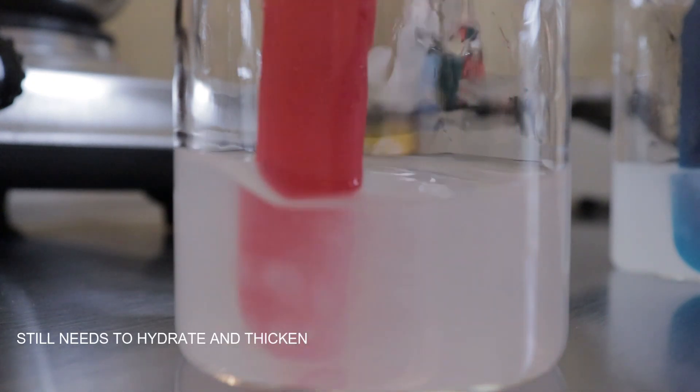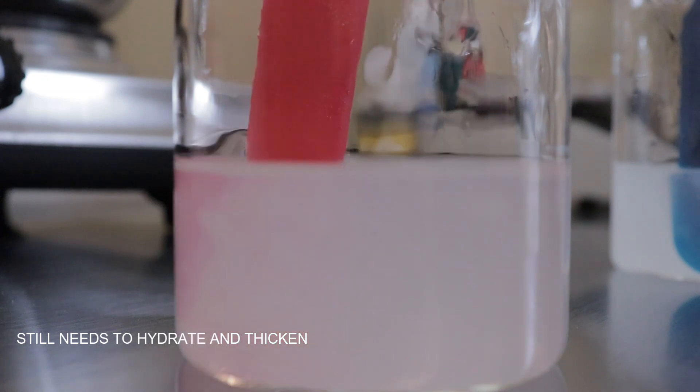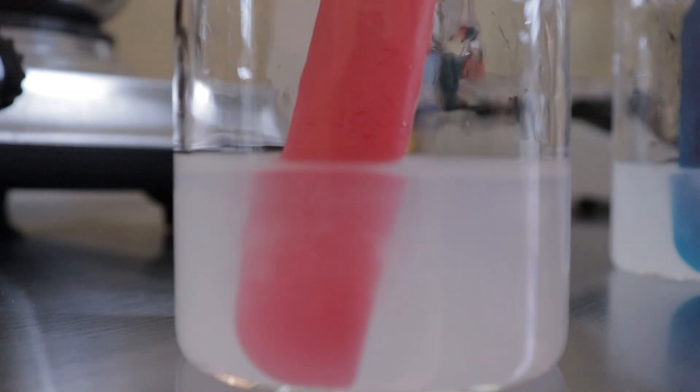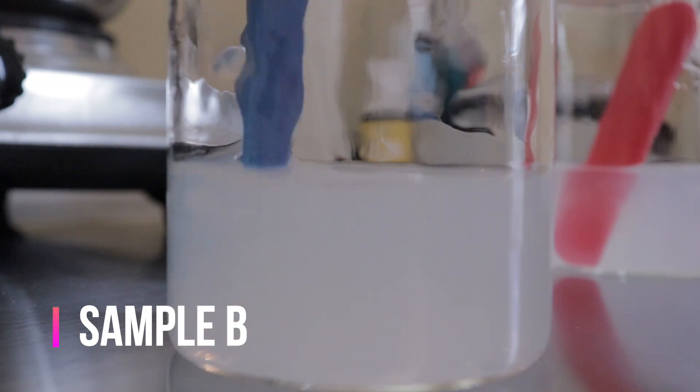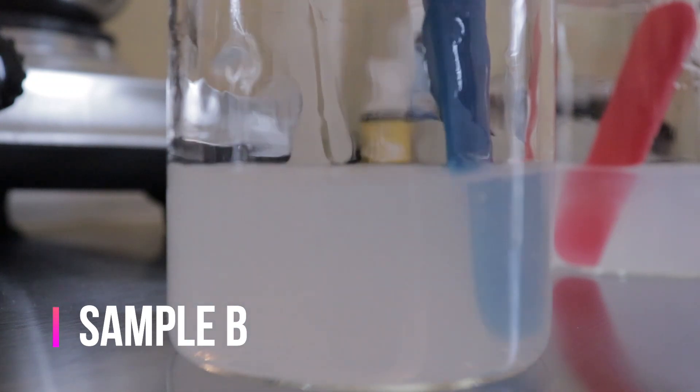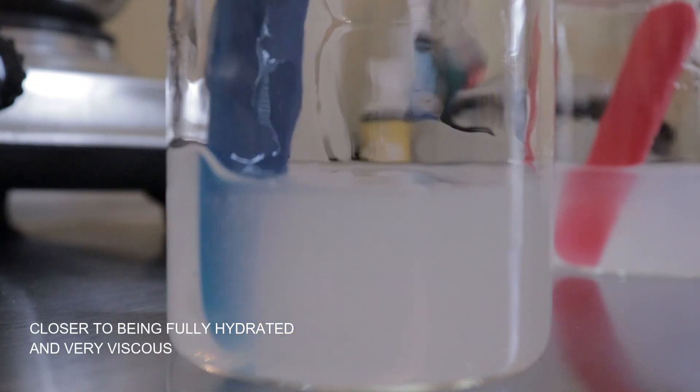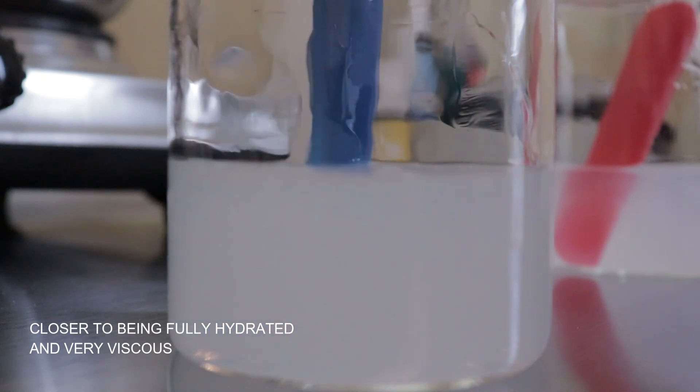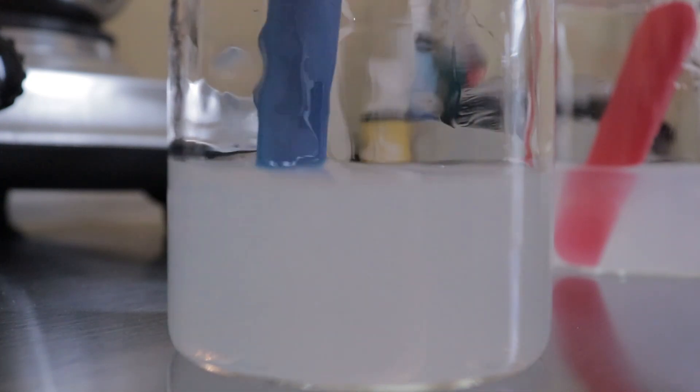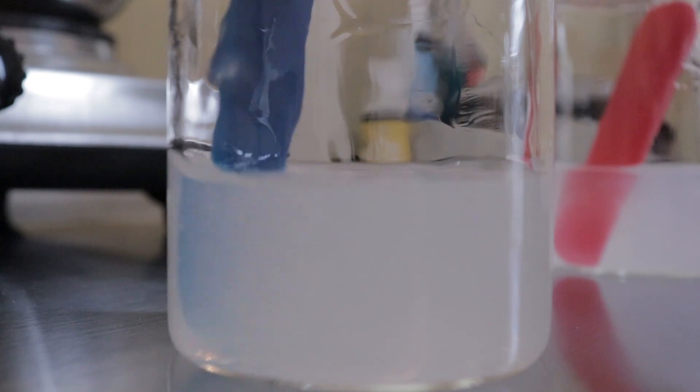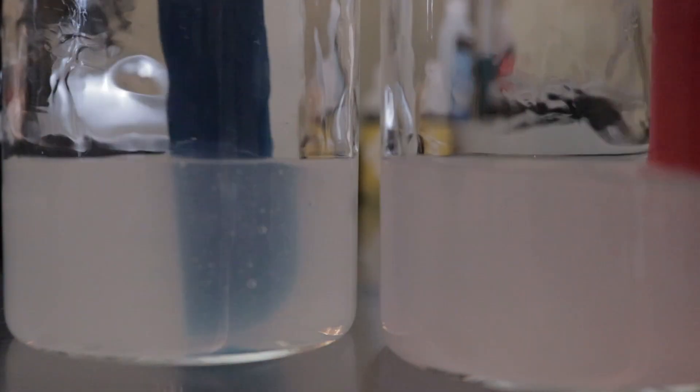Alright, as you can see, sample A and sample B are very different. The technique and the method is equally important as the formula because you want to make sure that you're developing a product or a sample that has stability and a great shelf life. Air can always come into a formula, but excess air can be an issue, especially in emulsions.